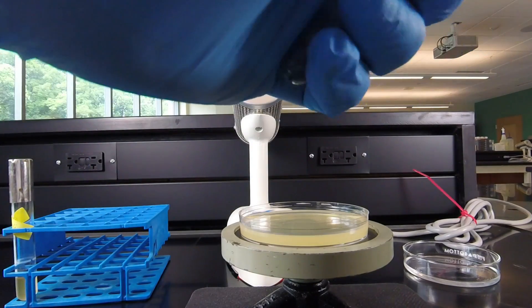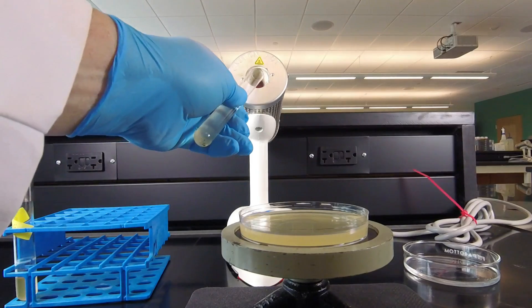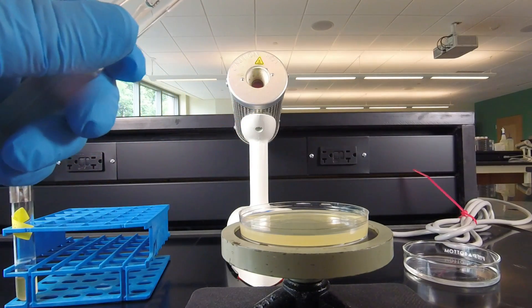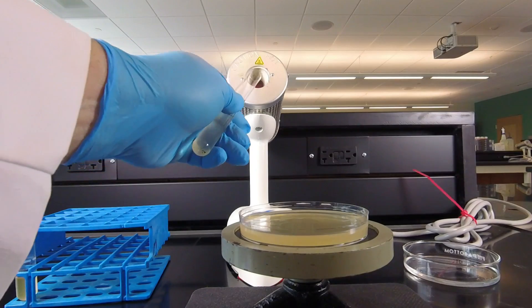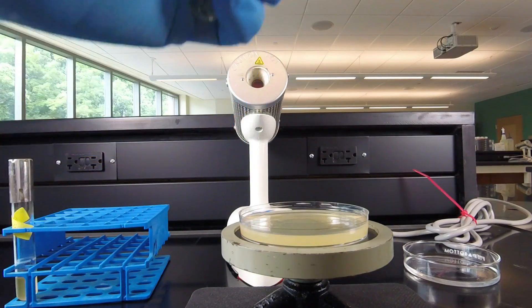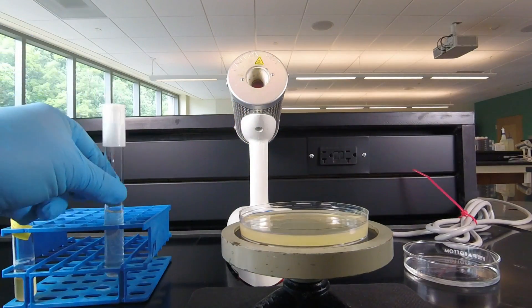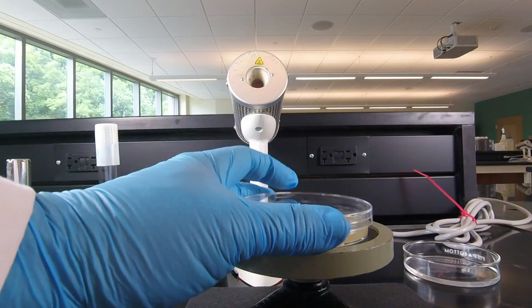Any bacteria that's left in the tube and the pipette we're going to put back in the tube that it came from. And now we're going to be ready to spread the bacteria out.